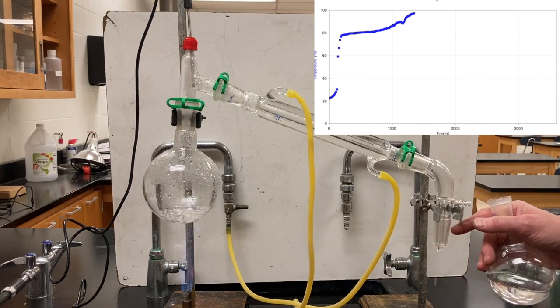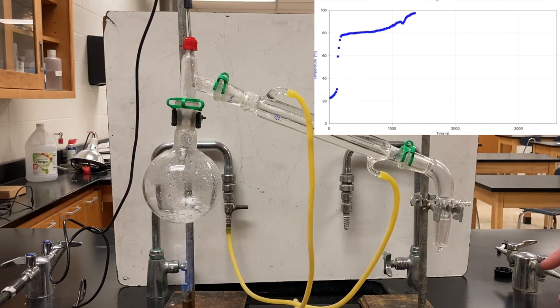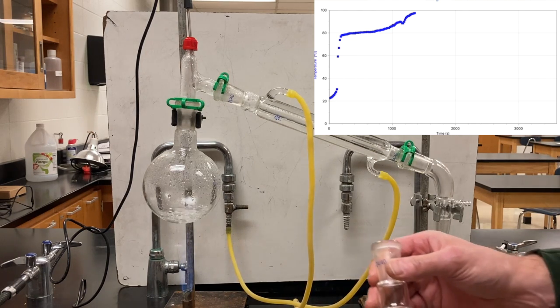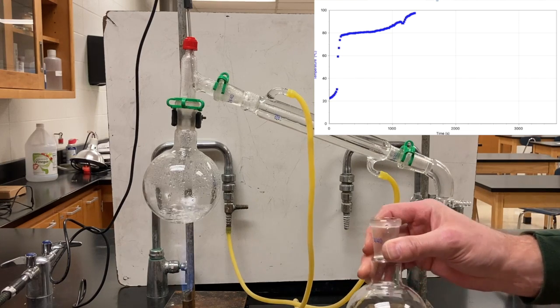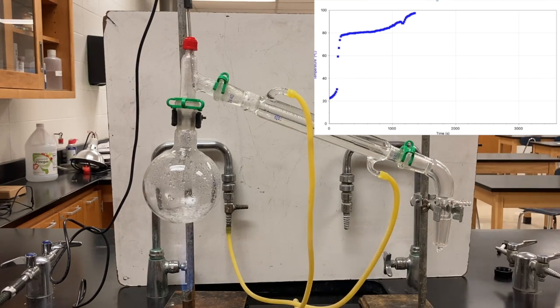I'm just kind of setting that in place and you can't see it, but I'm putting a beaker underneath the output from the condenser. So this flask should now contain, I think, alcohol, ethanol, or fairly close to pure ethanol.